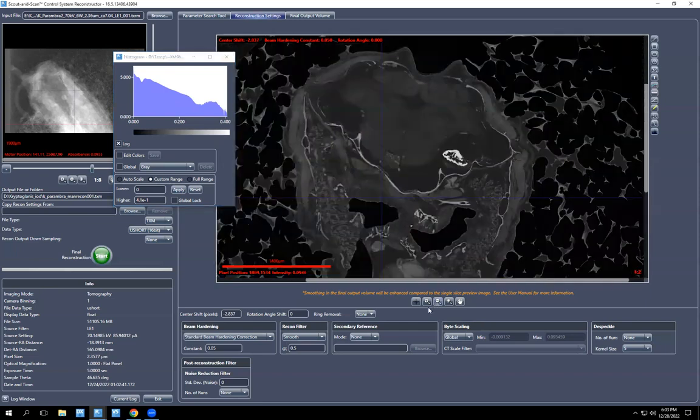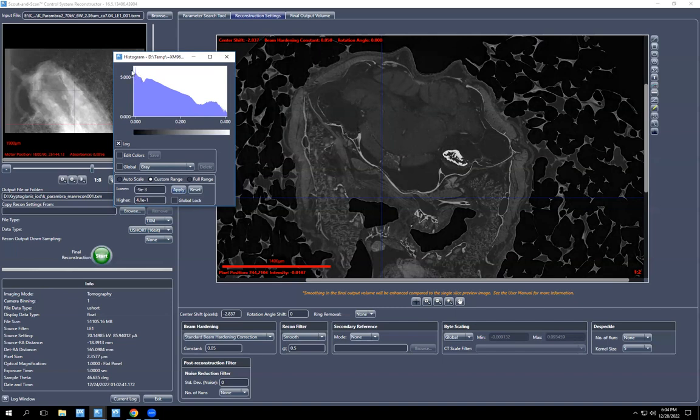Oh, wow. Thank you. Yeah, so you can play with it a bunch. If you do negative 0.009 or something like that, you can see how the data changes. You get this peak here. Earlier that peak is smashed up against the y-axis, so you can't see it. And you lose a little bit of data because your data gets scrunched together in gray values, but the image is almost a little bit nicer. That's hard to say. So I'm going to leave it at 0.41.